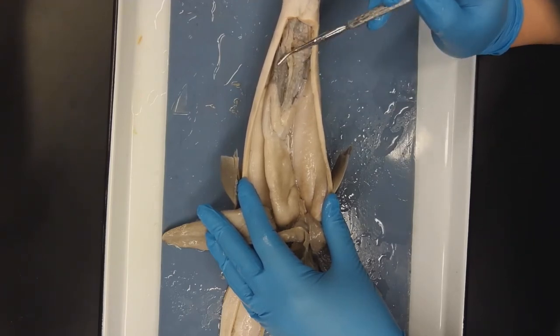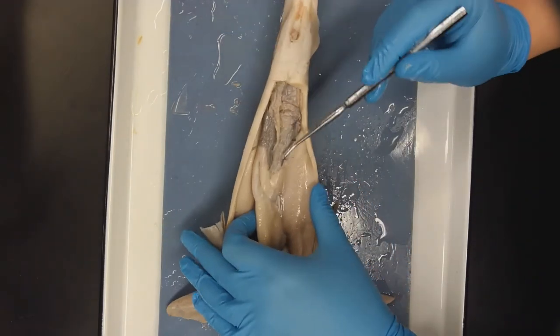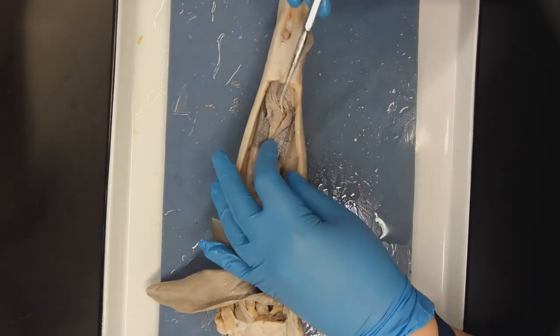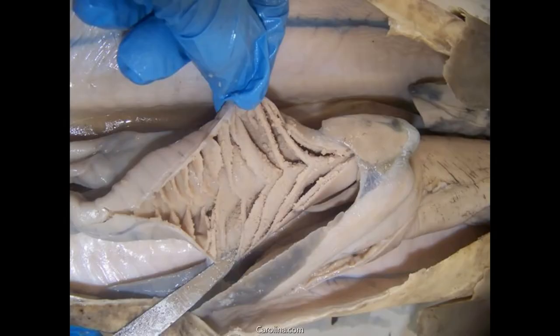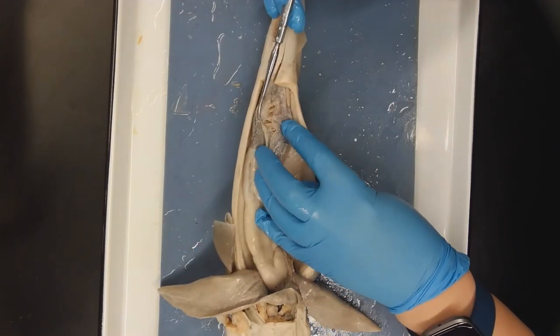This dark gray structure here is the spleen. And finally we move into the large intestine or spiral valve, which I've attempted to dissect open to reveal the many folds of the large intestine. We can see these folds more clearly in the image here, and these are specialized to increase surface area and absorption rates of the intestine.